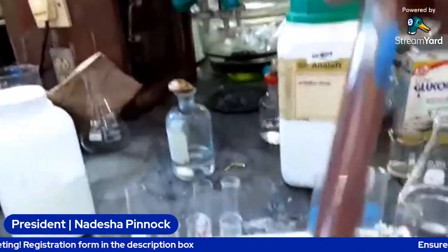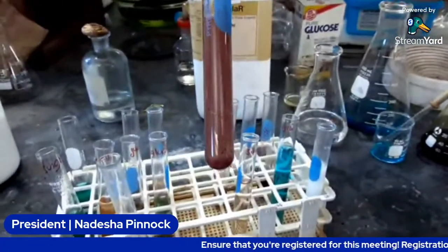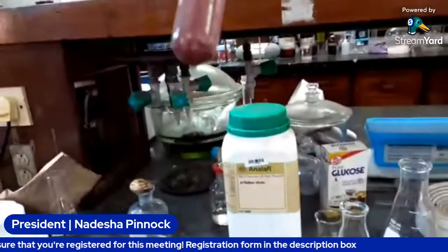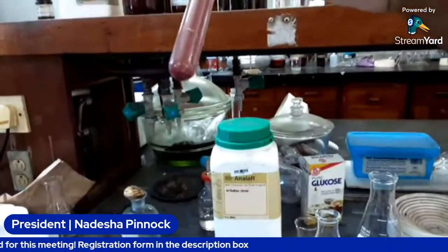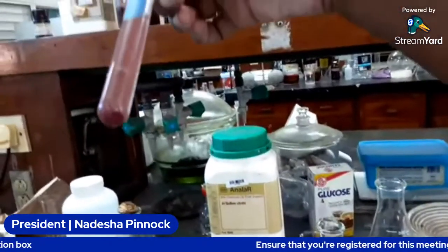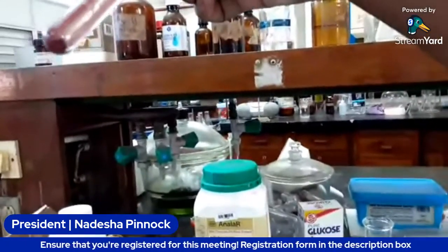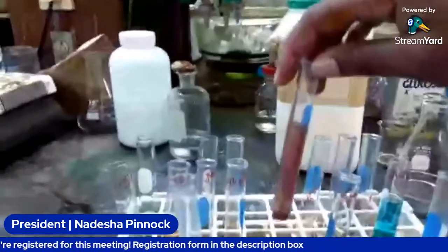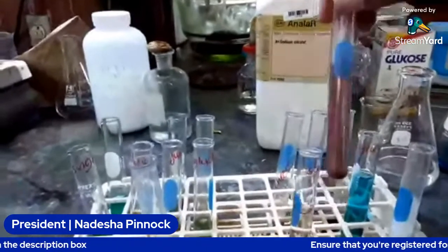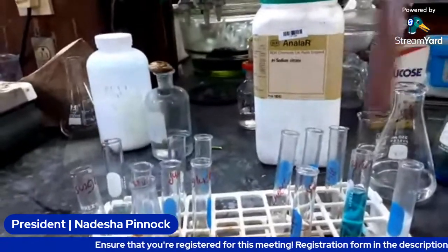This is the juice. I don't know if you guys are seeing it clearly. There we go. So this one is the juice, and as you can see at the bottom, there is some precipitate that was formed. So that means we had some complex sugars in it, whether it was sucrose or some starch, I have no idea.